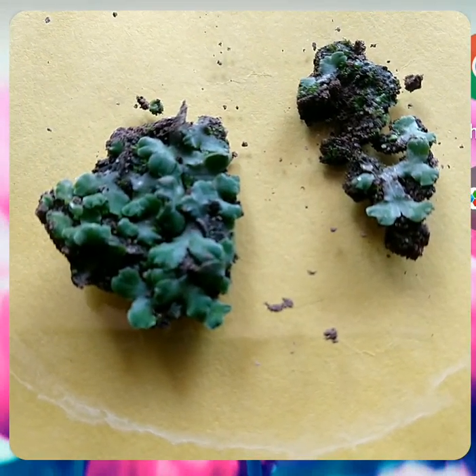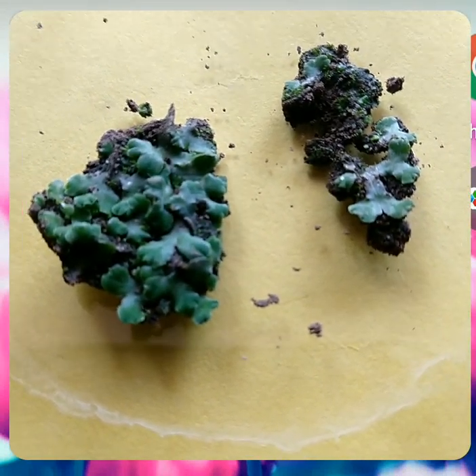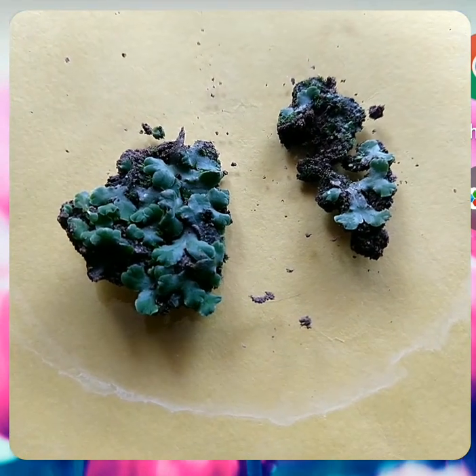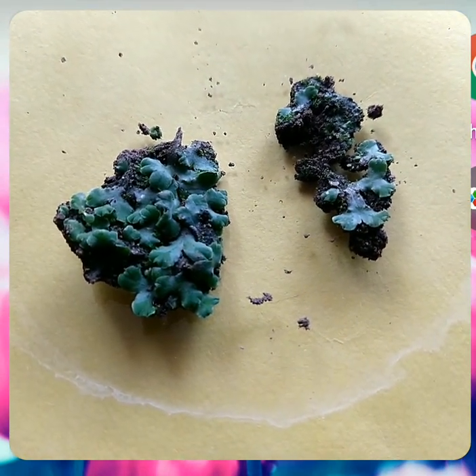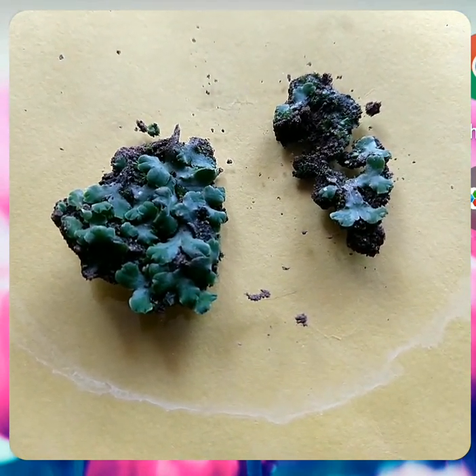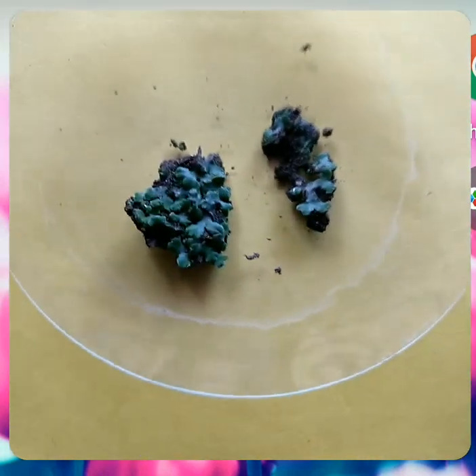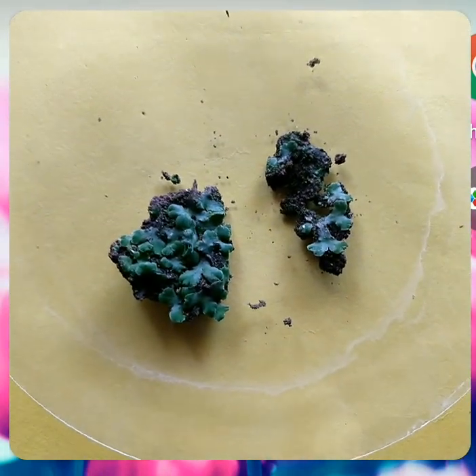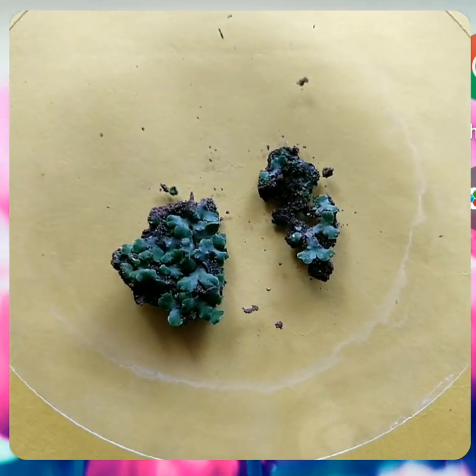Welcome to all. Dear students, in this practical, I will explain the diagnostic features of different gametophytes of bryophytes as per the syllabus.